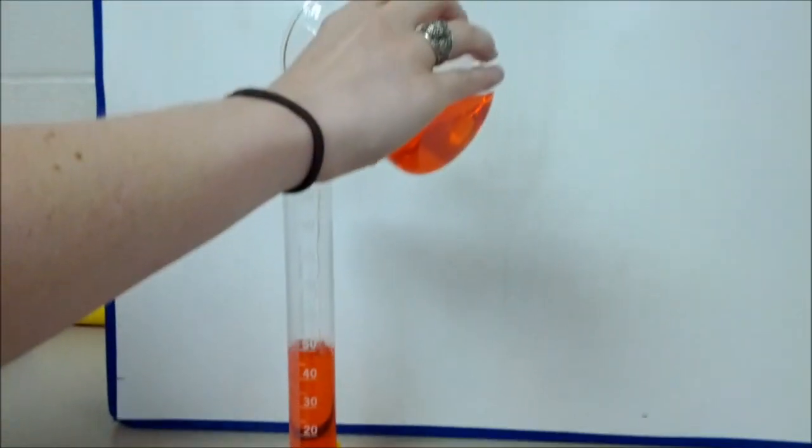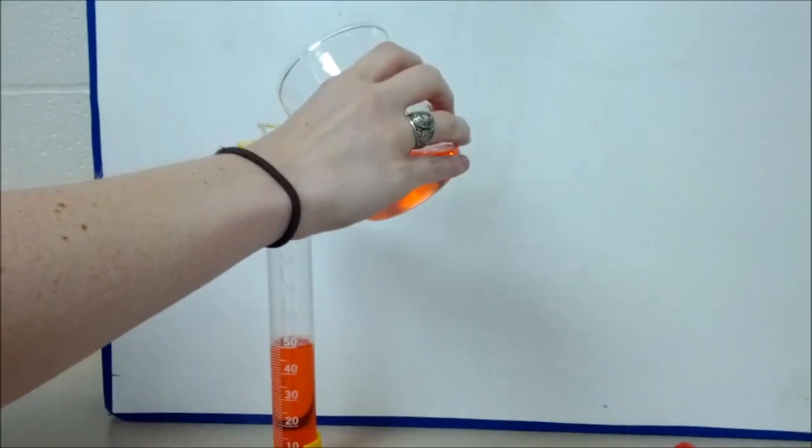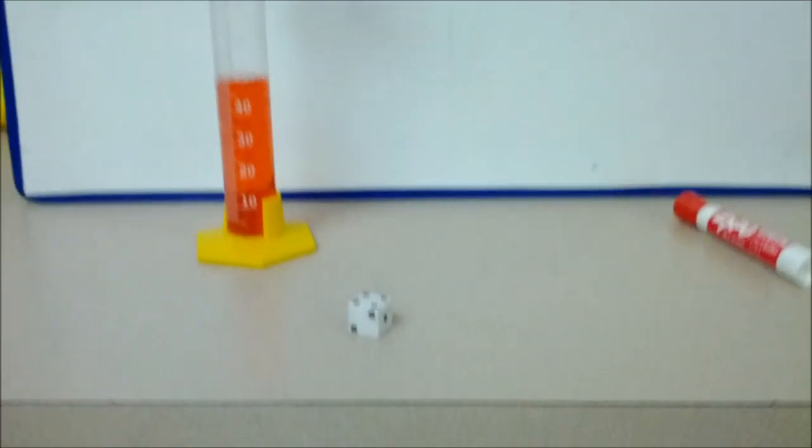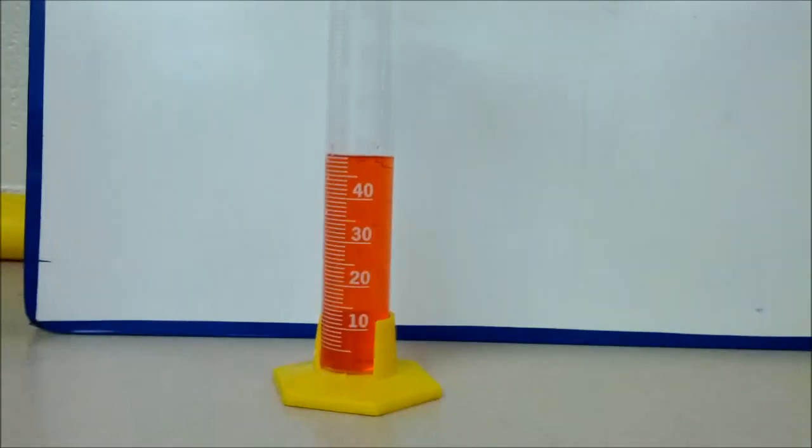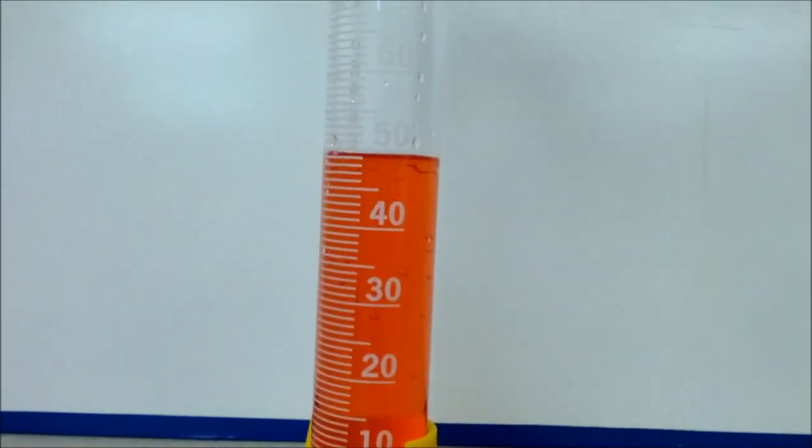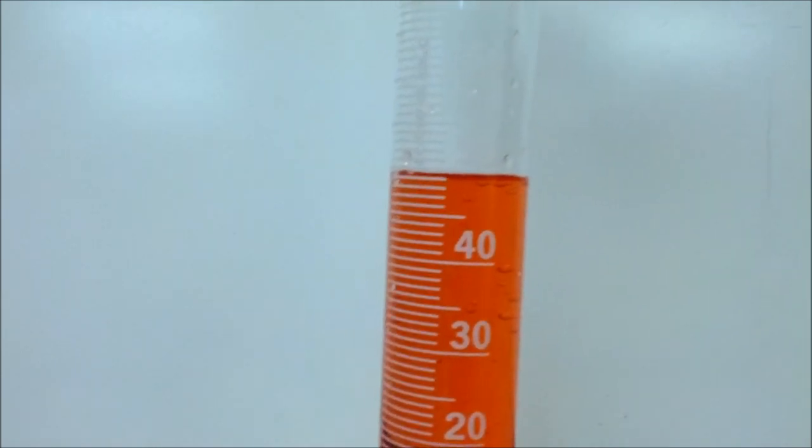Ms. Willem is helping me, and Ms. Fisher and Ms. Kloss. What we have to do to find the volume of this cube is fill our graduated cylinder up to an even number so it's very easy to find.